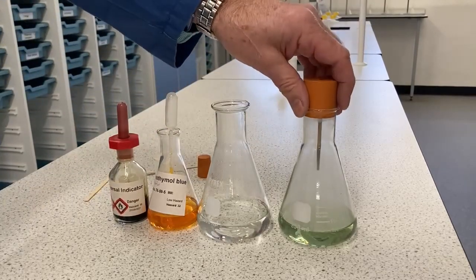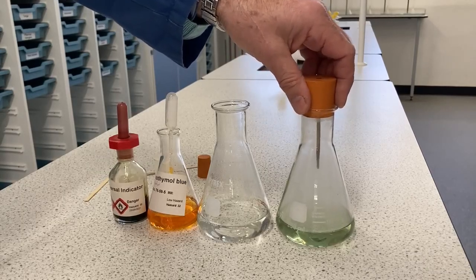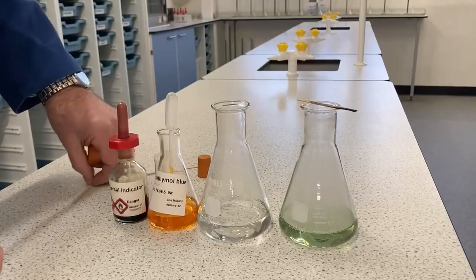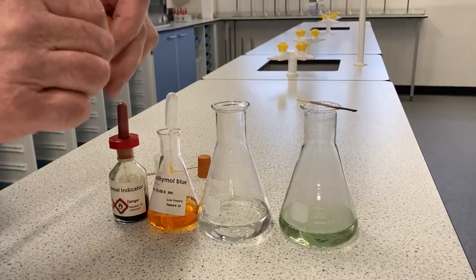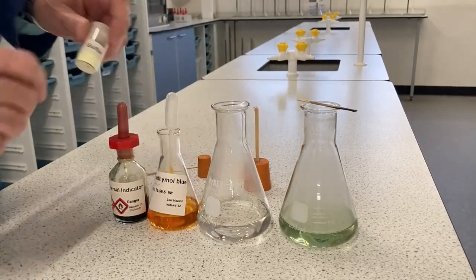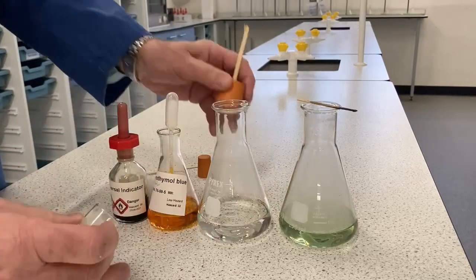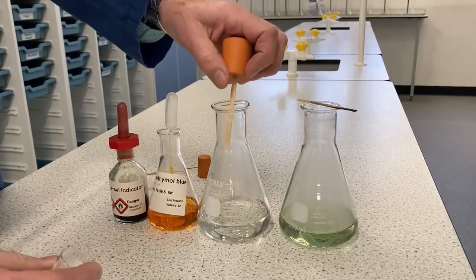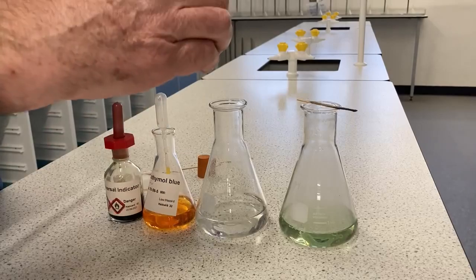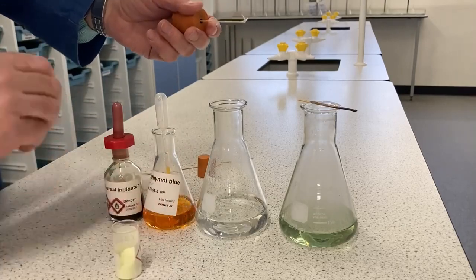Now, fossil fuels also contain things like sulfur or sulfates and nitrates, and worse acid rain comes from the sulfur dioxide in the air, from the sulfur that's in compounds that are being burnt. So I've got a tub of some ground up sulfur. I'm just going to dampen the splint a little bit and pick up a little bit of sulfur on there. I only need a very small amount on the splint.